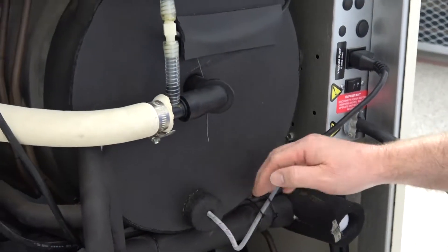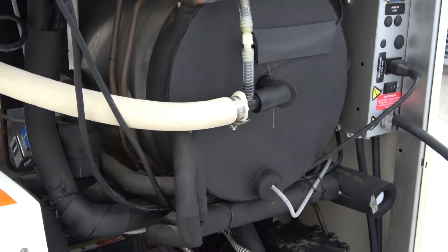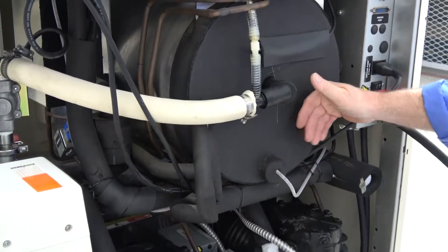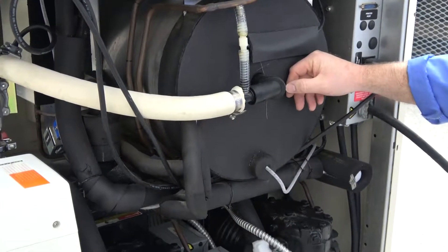And that was one thing I always take note of is this insulation isn't broke down. It's not deteriorating like I've seen in the past. So that's just a good indicator that this chamber, these pumps have very little use to them.